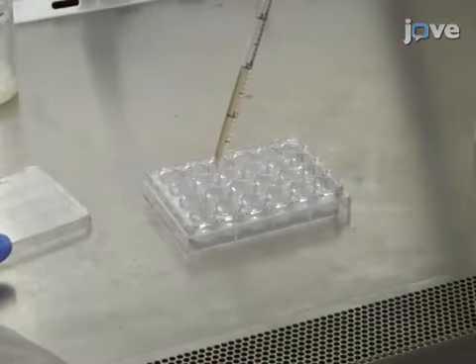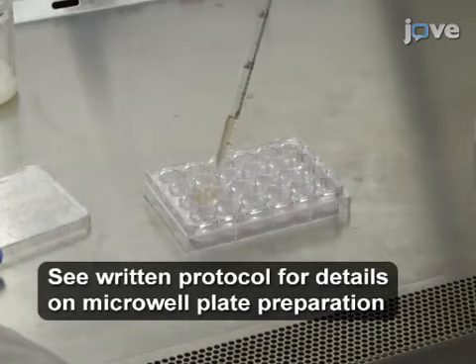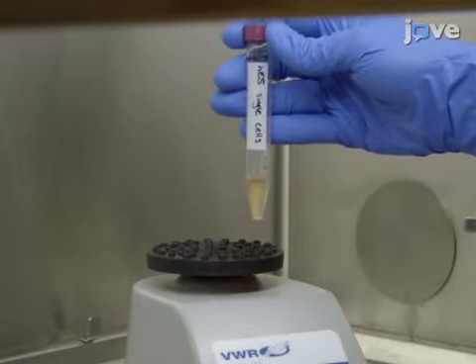Next, seed 1 milliliter of the cell suspension to each well on the prepared microwell plate and evenly distribute the cells. To seed a large number of wells, periodically vortex the cell suspension to prevent settling.